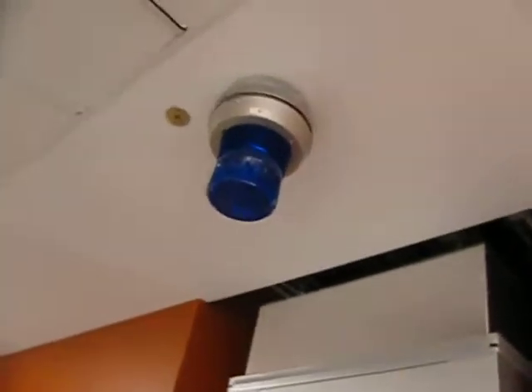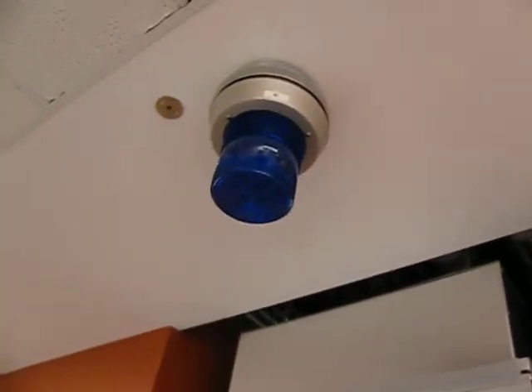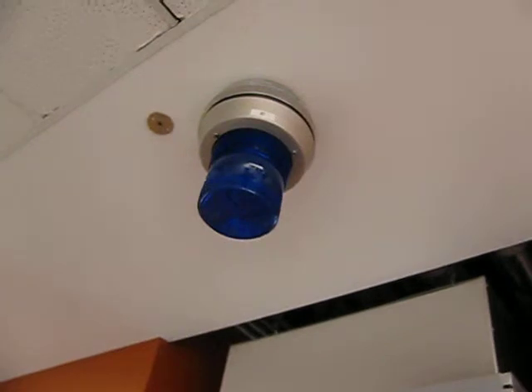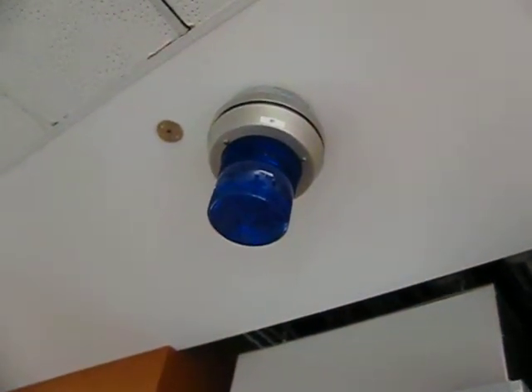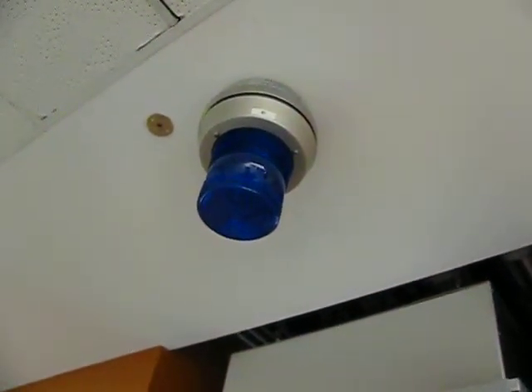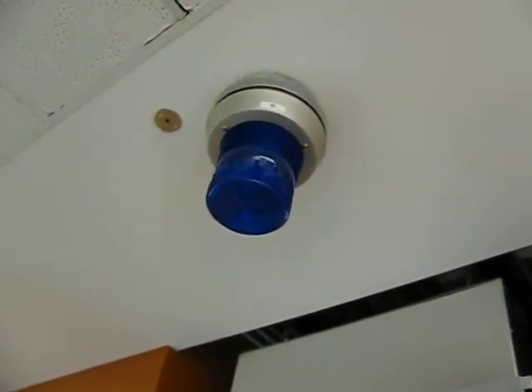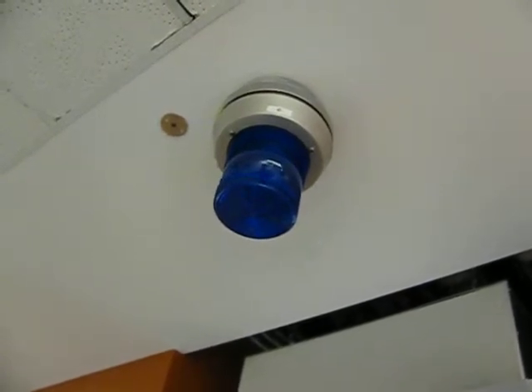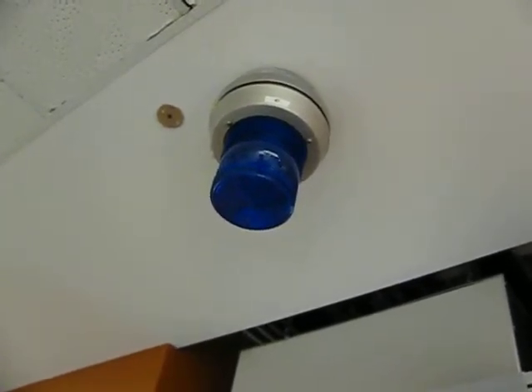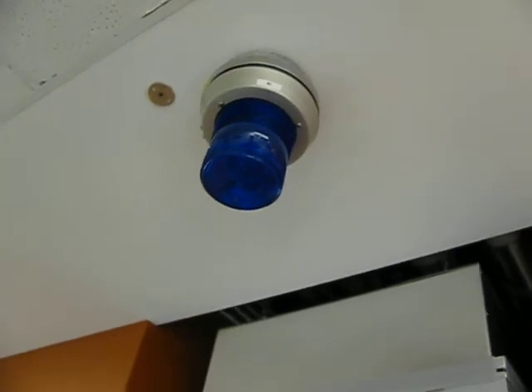Furthermore, if any of the sensors detect abnormal amounts of gas, flashing blue lights in three different zones will be activated along with a honking alarm system.